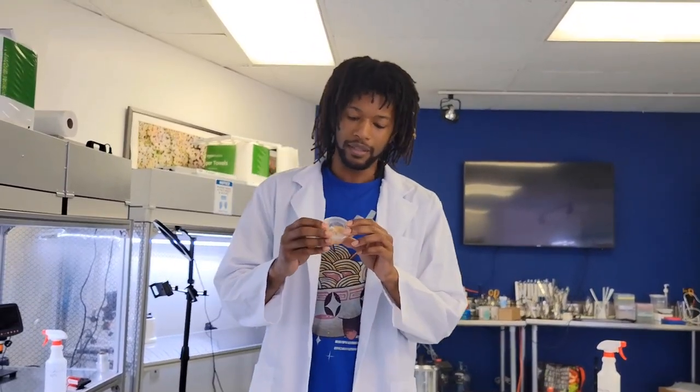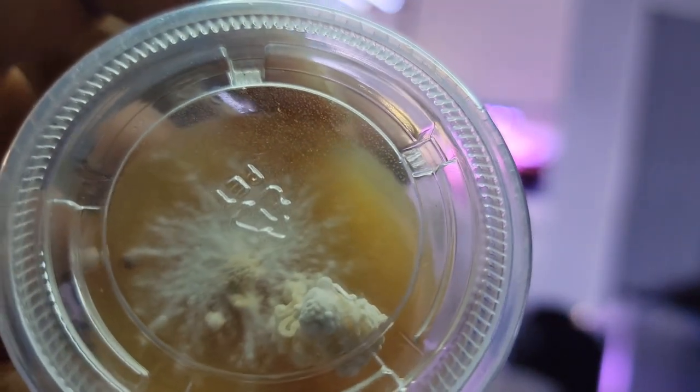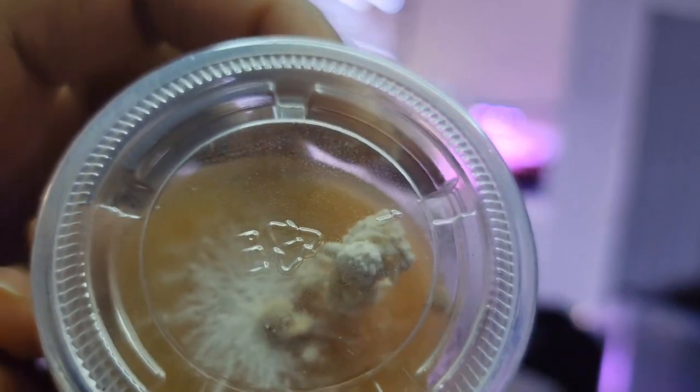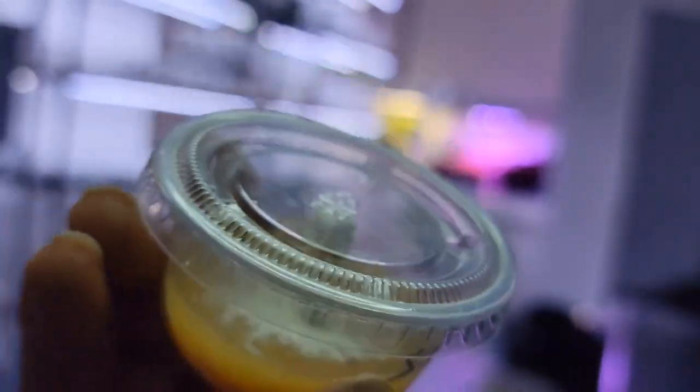We've also got this other local lion's mane, a fan favorite, and this one's pretty cool. This was the first time I ever found lion's mane wild in person. I found it at a dog park while I was just walking some dogs—you never know when fungi are going to find you. So I took a culture of that and put it on a petri dish.